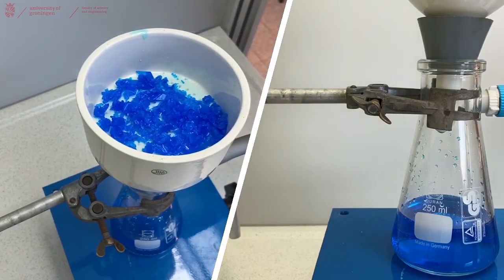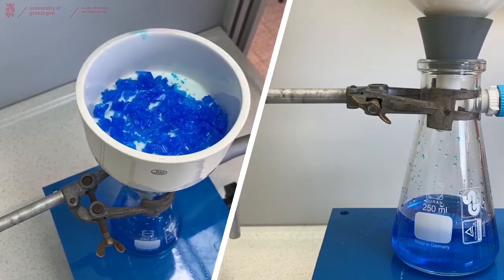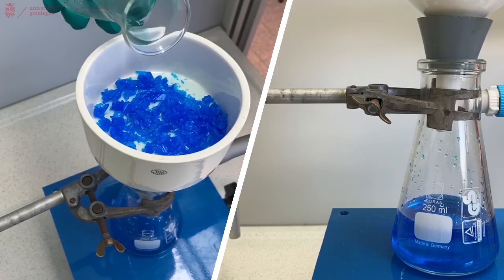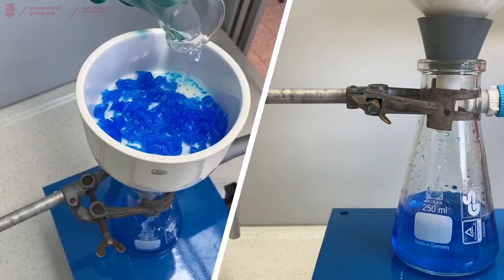For demonstration purposes I will not use all the solids, and we have here some ice-cooled water to rinse the solids of any remaining mother liquor from our recrystallization to get pure crystals.